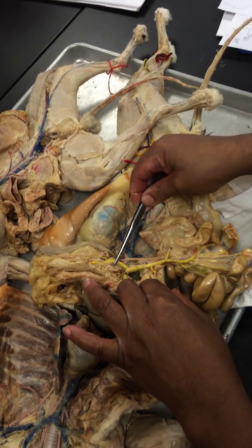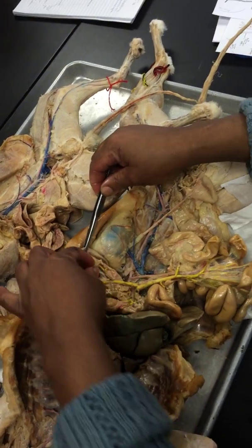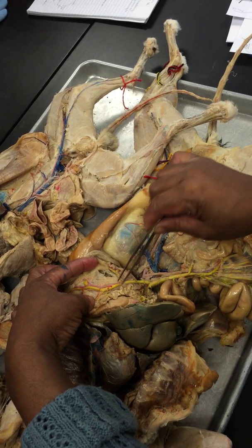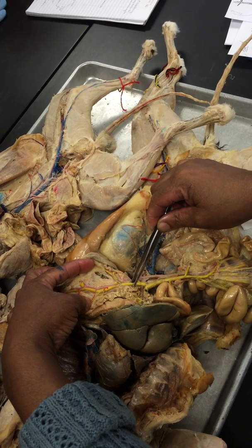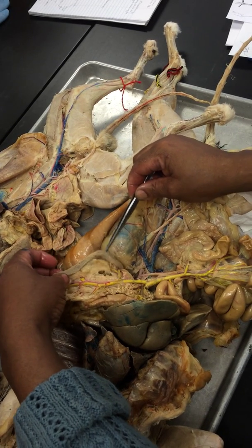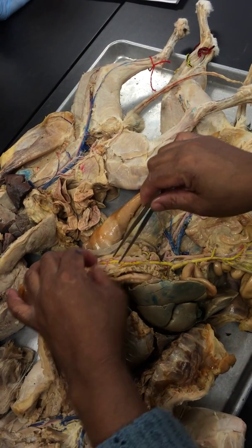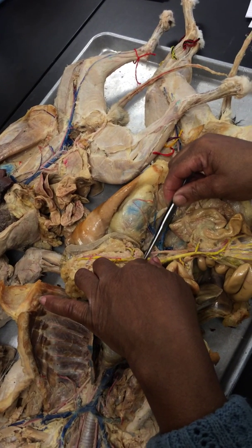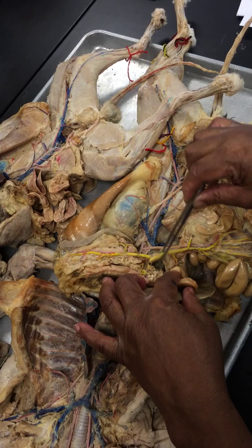So over here you have another big trunk, and actually it arises from two vessels, this one right here and that one right there. So these Y makes this trunk right here. The trunk is the gastrosplenic, and this Y takes you into the spleen. So this is the splenic, and this Y takes you into the stomach over here. So the gastric. So this big piece here is the gastrosplenic. The gastrosplenic meets up with the superior mesentery.